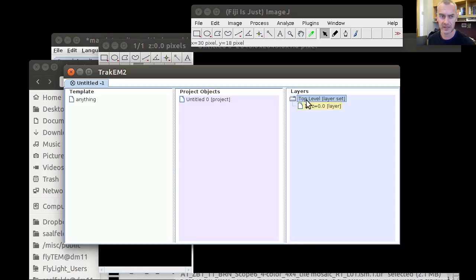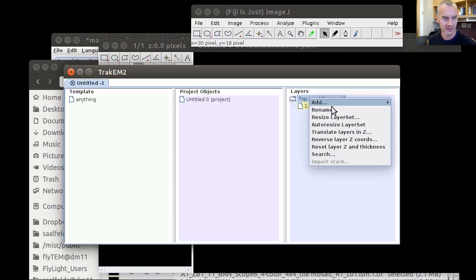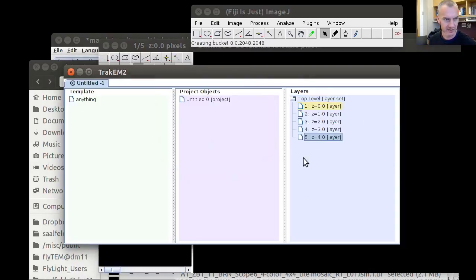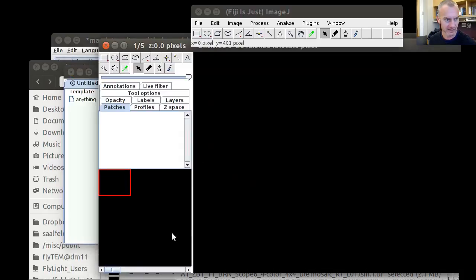In our acquisition, we have 5 channels. It's actually 4 wavelengths, but the 488 wavelength is present 2 times. And in order to get a better idea of what our lens correction model is eventually doing, we're going to process that as an individual channel twice and then compare the results. So here we add many new layers, 5 in fact, and we're going to skip over the existing one. So we have 5 individual layers that we can scroll through here in the canvas window.